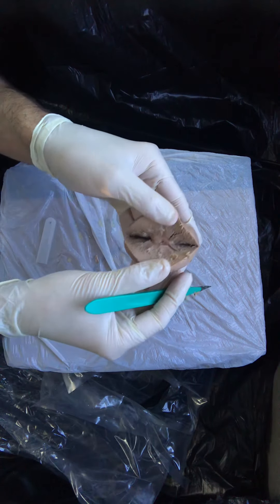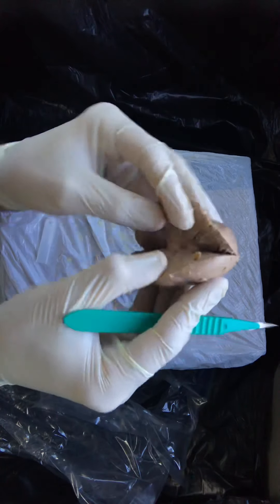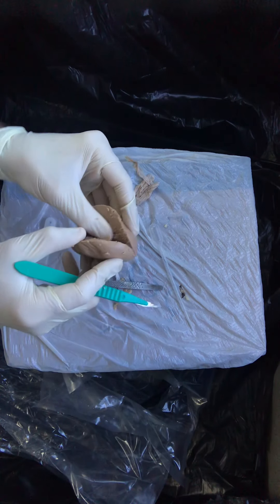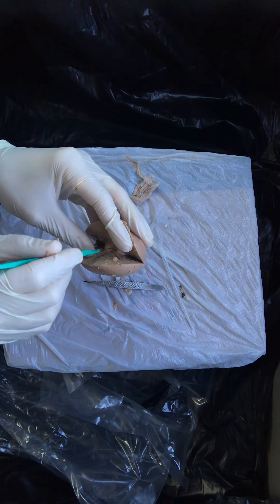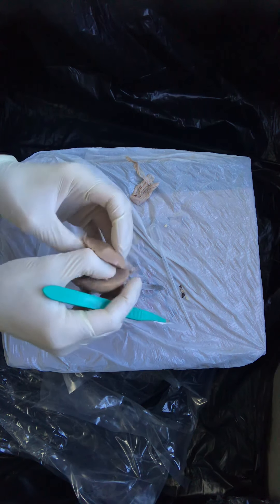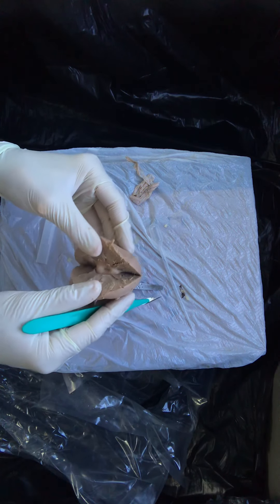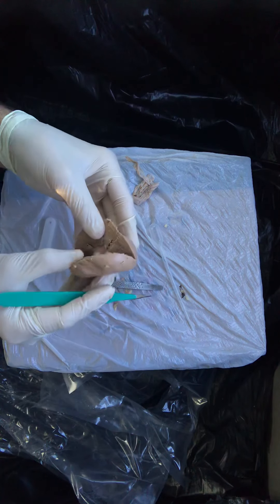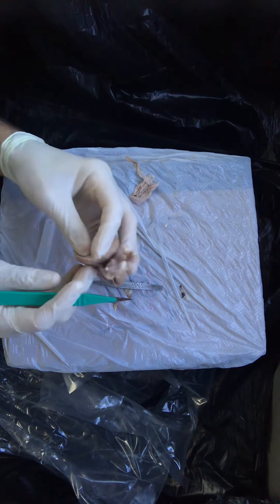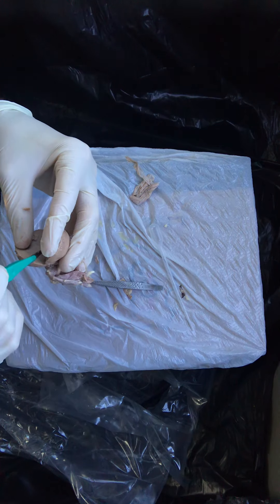As I'm opening those up, it's going to allow me to carry this incision down and really open this kidney like a book. Going little by little — because if you go slow — then eventually you're going to come to the renal pelvis, which is this funnel-shaped confluence of all the major calyces. We're looking at it in three dimensions now, intact before it's been cut in half the way we've been seeing in the diagrams. Remember these things we're looking at are three-dimensional structures — 2D cartoons of 3D structures.